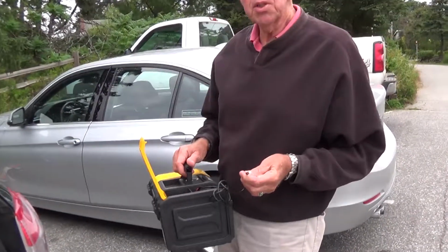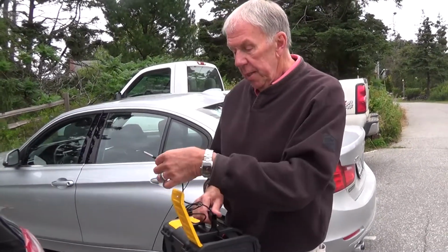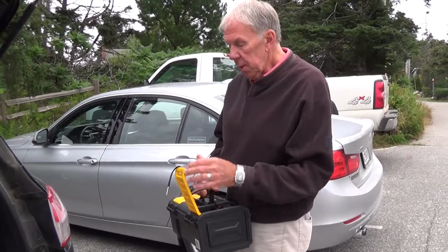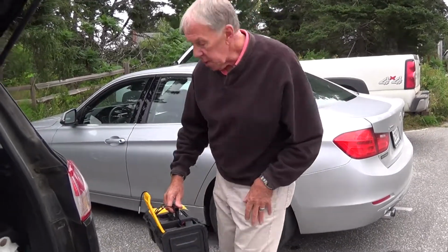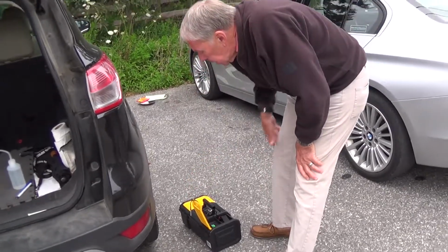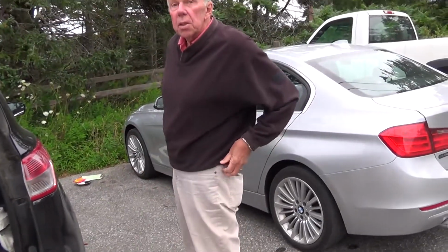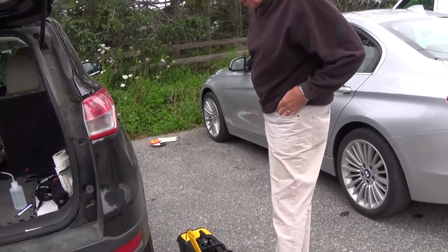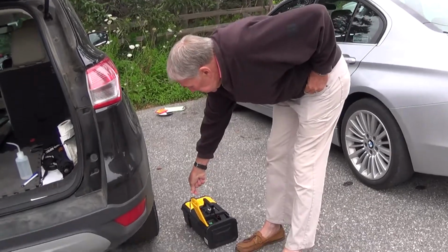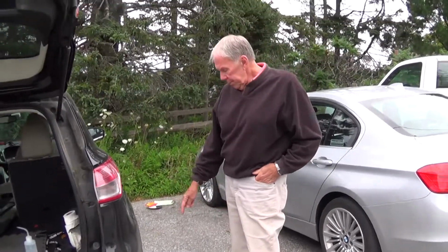And I always put this in the shade. One of the things you don't want to do, and I usually hang it over like this, is to leave that in the sun. And you don't want this probe, or the end of that probe, to be touching any object. That will give you a bad reading. And the clothespin is to secure that in case it can't hang freely.